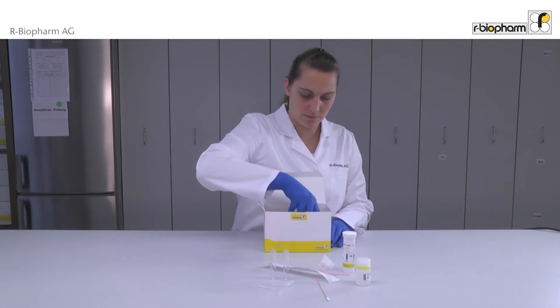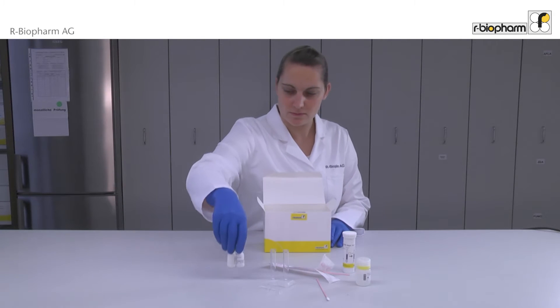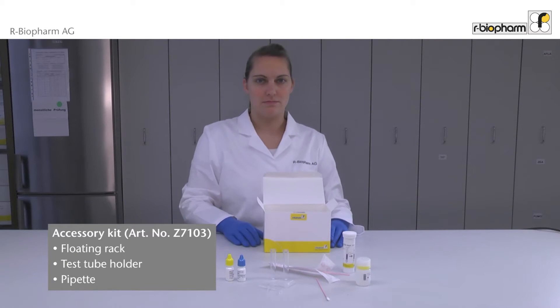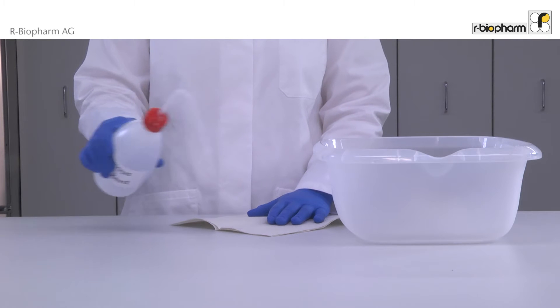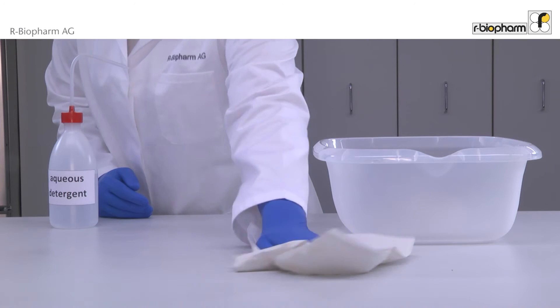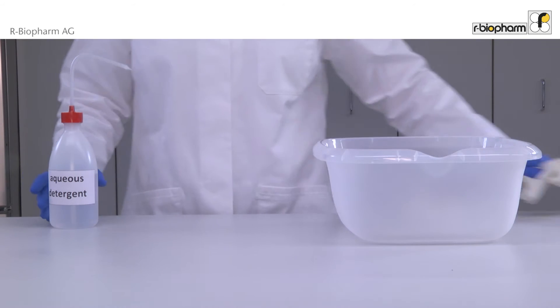It is recommended to use the accessory kit. Before starting, make sure that surfaces and equipment are free from soy. Use an aqueous detergent to wipe surfaces and rinse vessels.